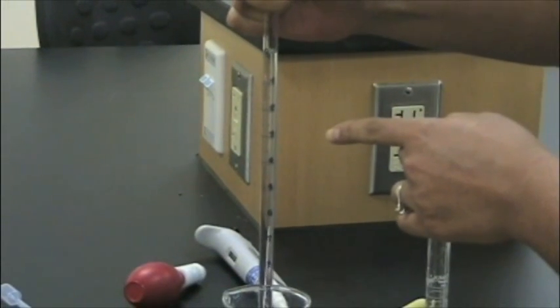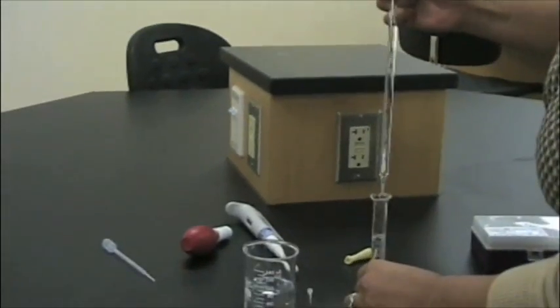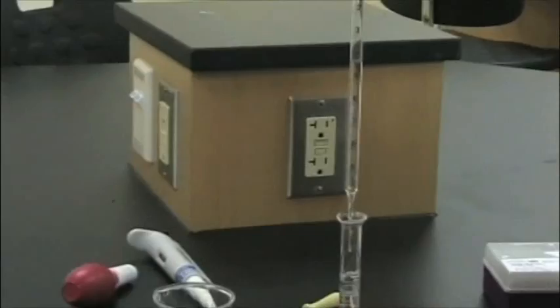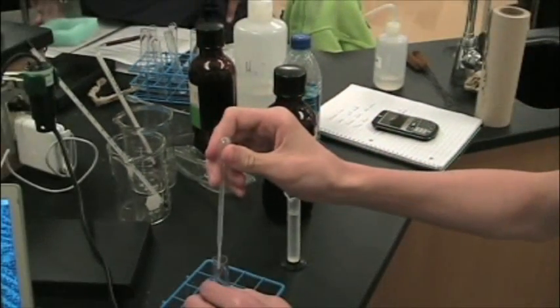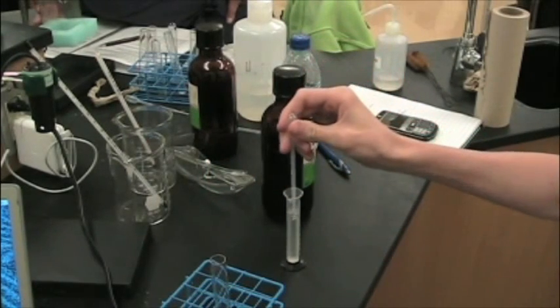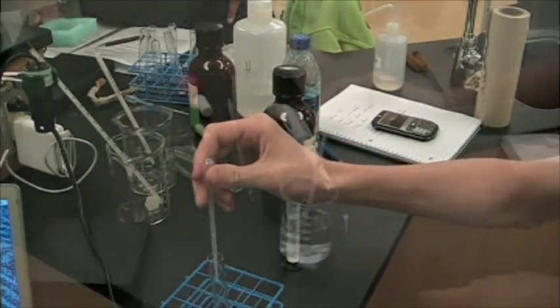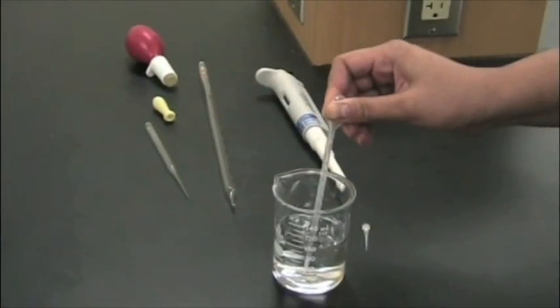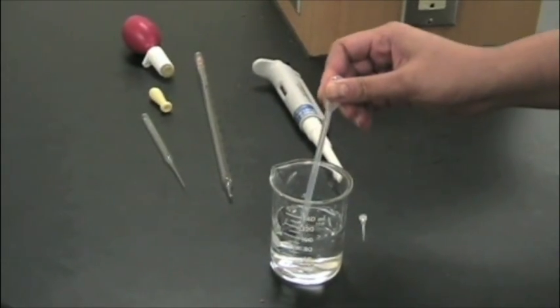For example, a 10 milliliter pipette will have markings on it that allow the user to measure volumes up to one tenth of a milliliter accuracy. Simple pipettes use a simple procedure for drawing the liquid and placing it into the receiving container. A plastic pipette has a bulb attached to it, much like a dropper. Squeezing the bulb removes the air from the bulb creating a vacuum. Then placing the pipette into the liquid allows you to draw the volume that you need.